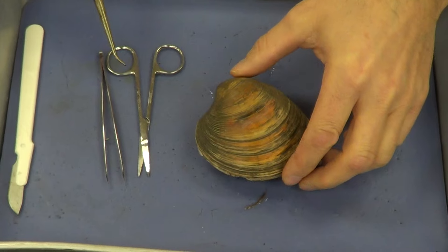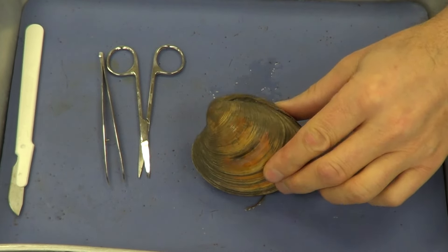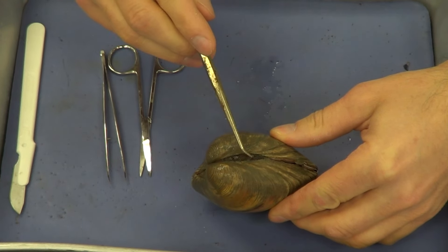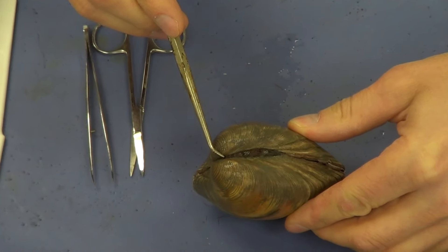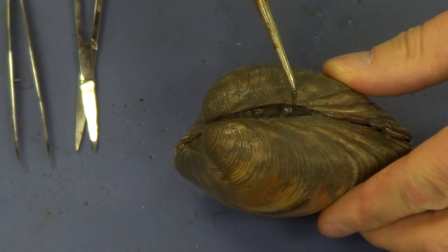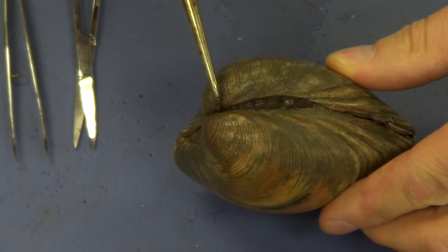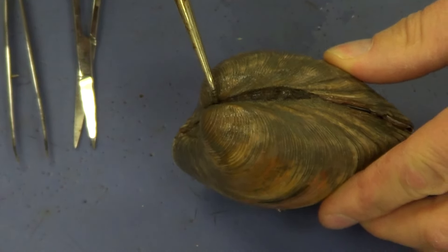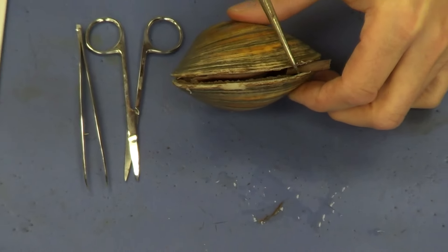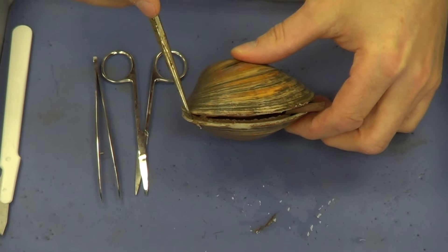The first thing we want to do is orient ourselves. If I turn the mussel up, we see this dark region right here. This is the hinge of the mussel — this is where the bivalve is going to open up. The hinge constitutes the dorsal aspect of the mussel. Opposite that is the side that actually opens up — that's the ventral side or ventral aspect.